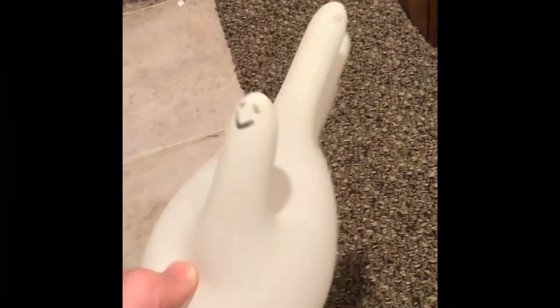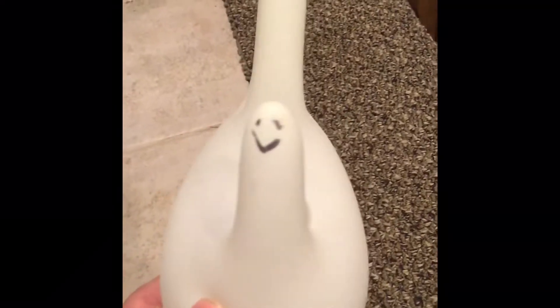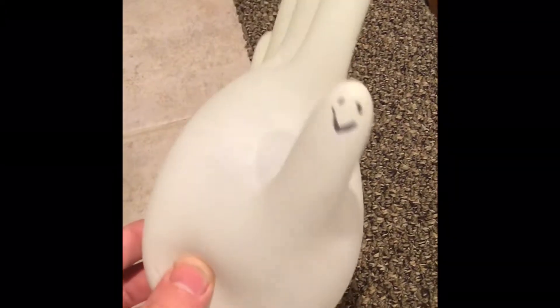This is my pal Steve. He's a glove. Many people probably want him, but I filled him up with hydrogen gas by the reaction of sodium hydroxide and aluminum. I'm gonna go light him off. He doesn't float because the glove is too heavy, but I might go balloon, see if it floats.